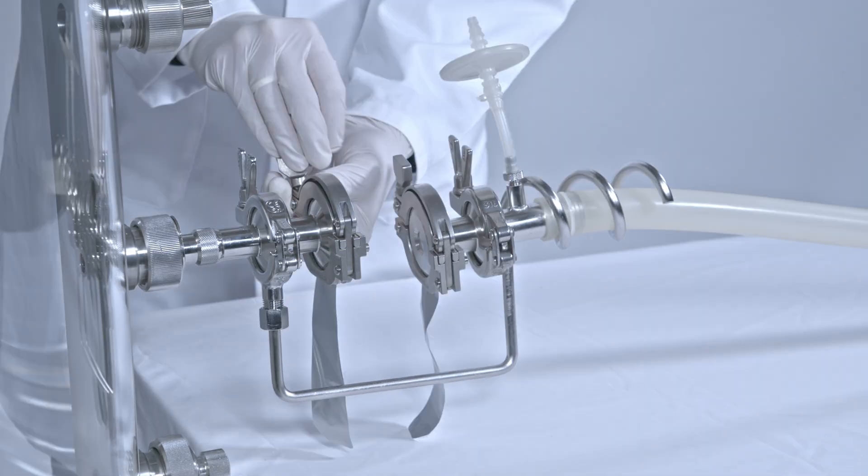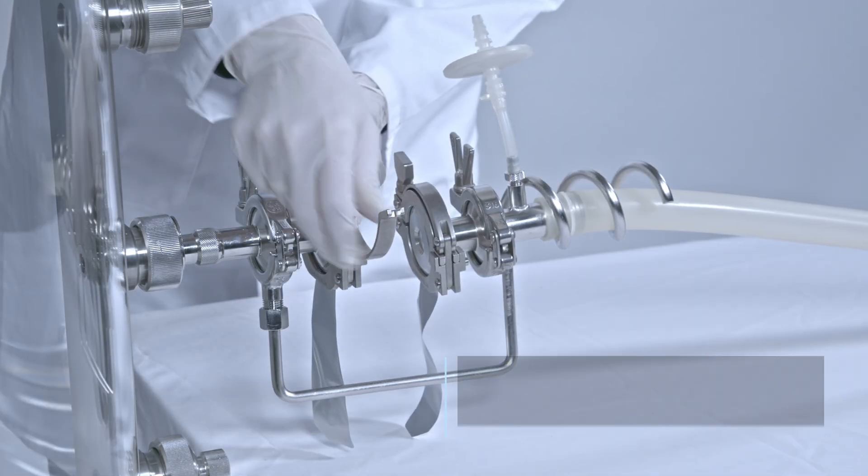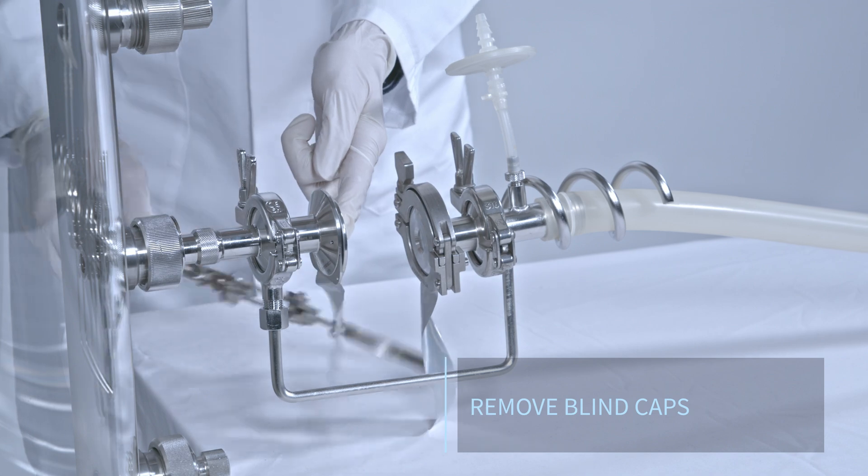The connection process is straightforward and consists of four steps. One, remove the blind caps.